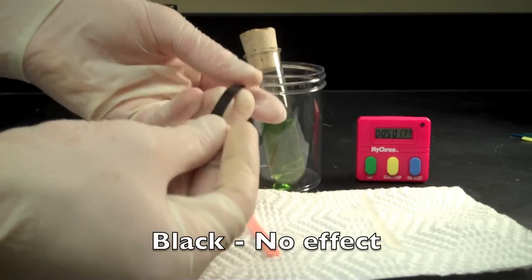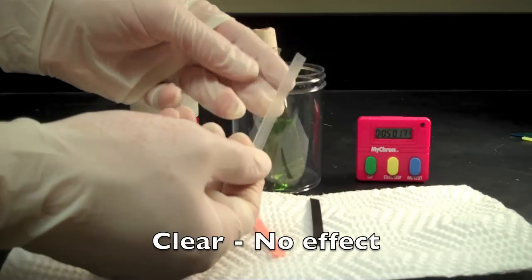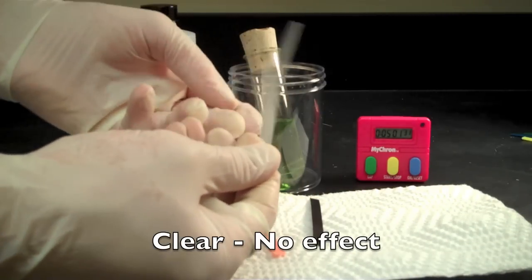The acetone had no effect on the strip of black plastic. The acetone also had no effect on the strip of clear plastic.